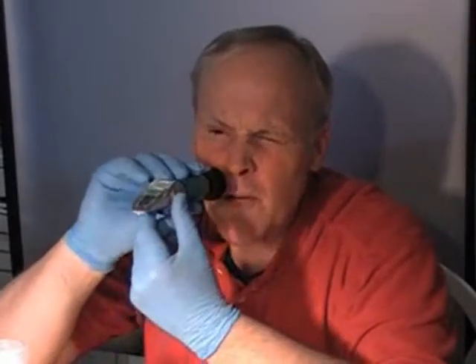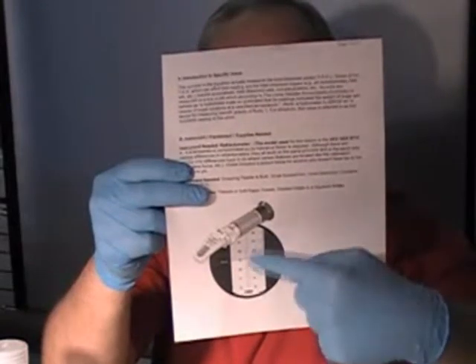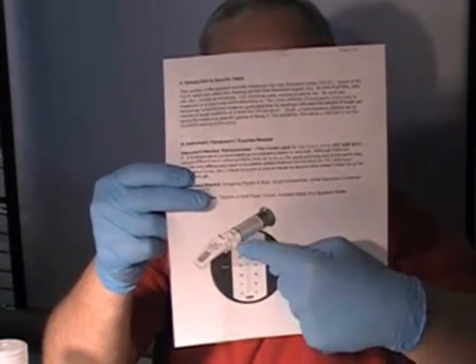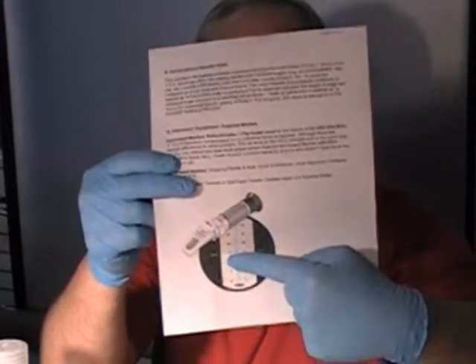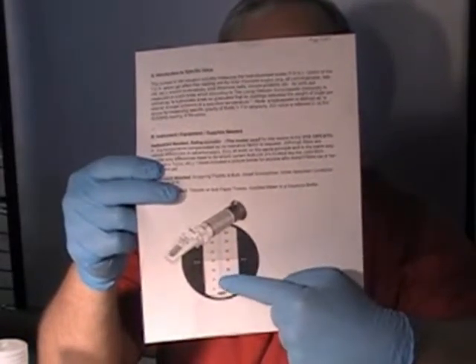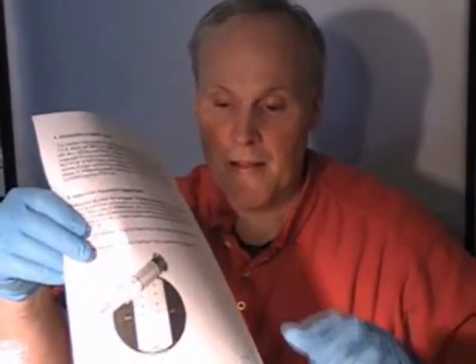What you're going to do is look through your refractometer. I'm going to give you a picture of what you're going to see — you're going to see something like this in the window. Do you see this circle here and this scale? In this refractometer, this part is blue. Your scale goes zero to 30 and that shadow will come up or down where your reading will be. When we calibrate, we want this shadow to be on the zero line because distilled water will have no dissolved solids in it.